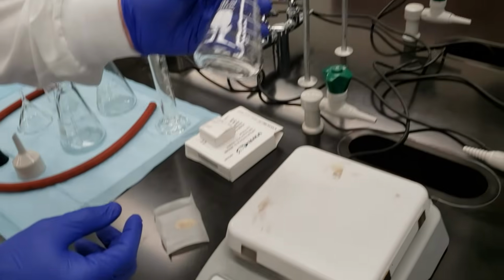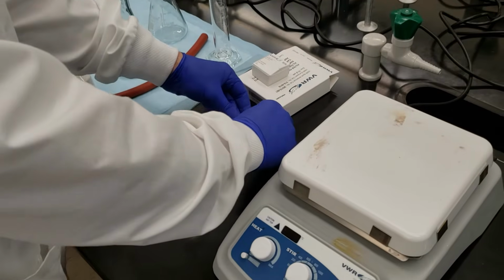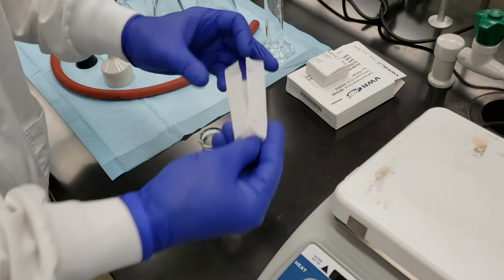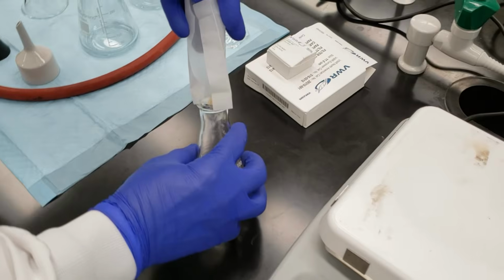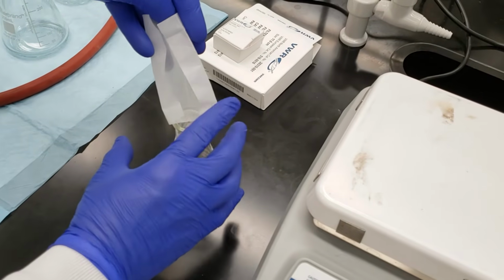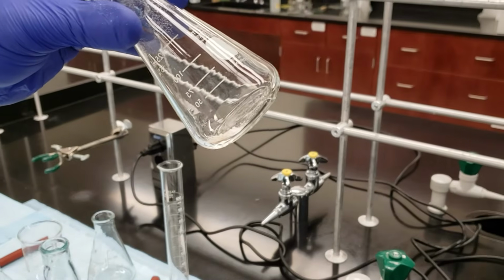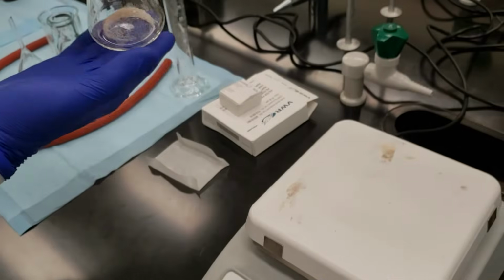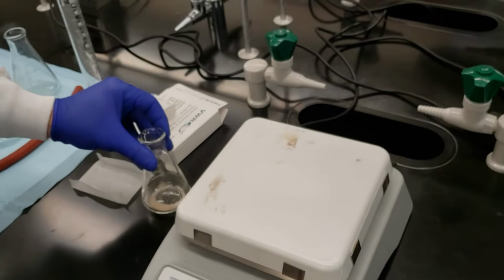And I'll go ahead and pour it into our 125 ml Erlenmeyer flask. I'm just going to bend my weigh paper right in the center. I'll do this in your direction here. And just pour that down into the bottom of the flask. And we can see it down on the bottom there. Does that show up okay? Yeah, it does. Good. And this is what we're going to be separating out. We can see our white crystals and our sand particles.